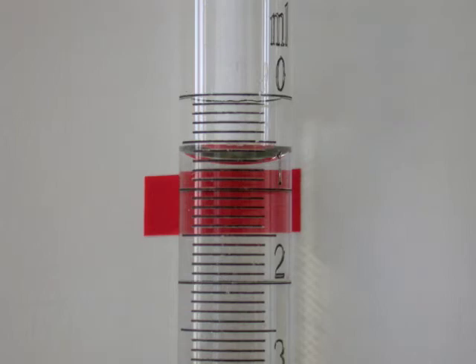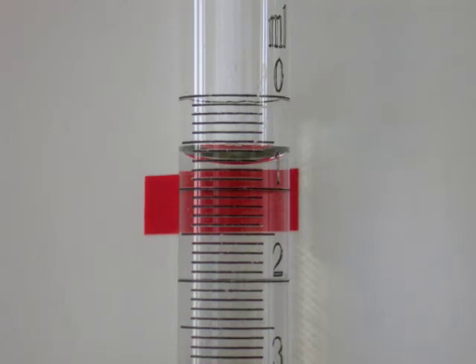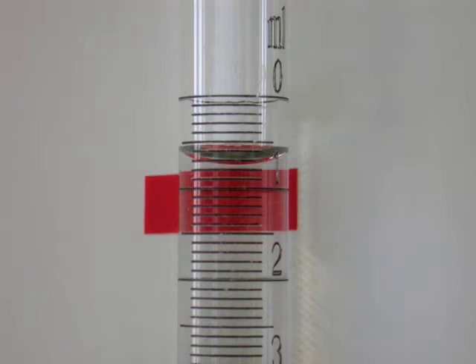This last digit is a guess, but with a little practice you can learn to be very consistent and obtain reproducible and accurate data to the nearest hundredth of a milliliter. That should be your goal in your work today. Be sure to record your initial reading in each of your titrations.